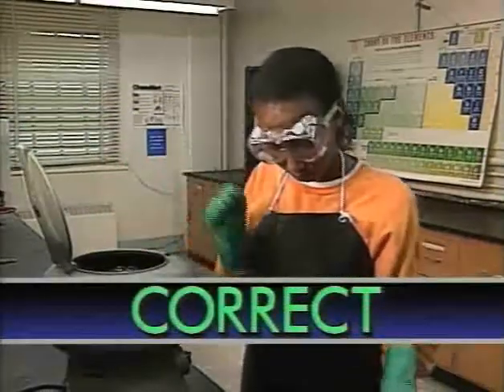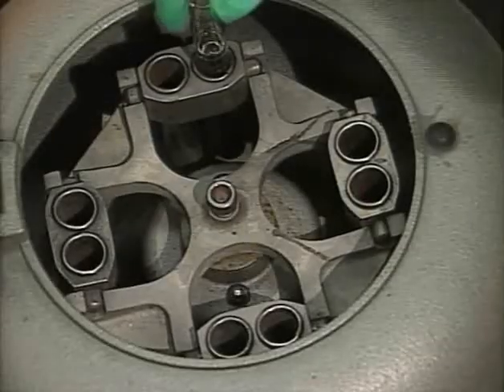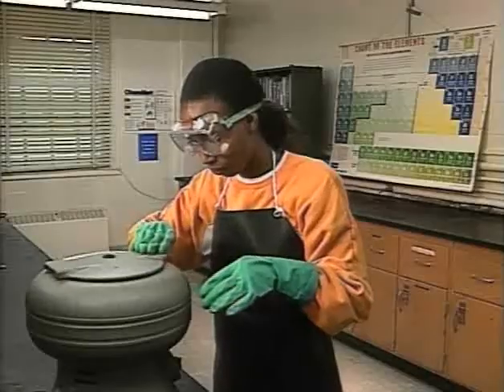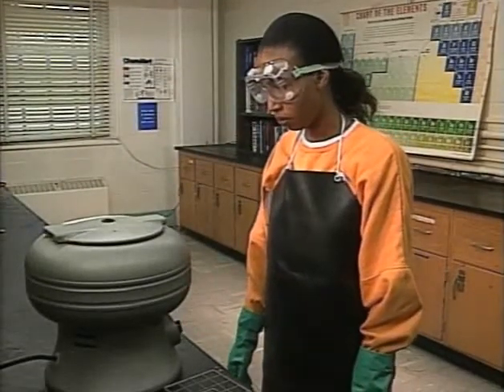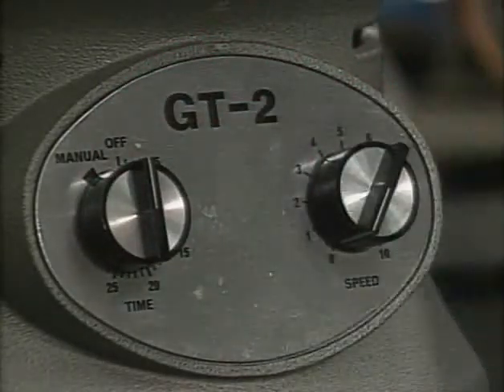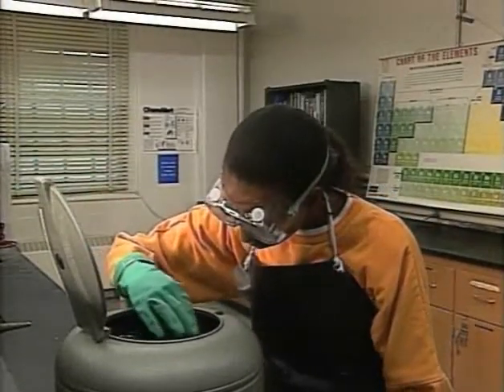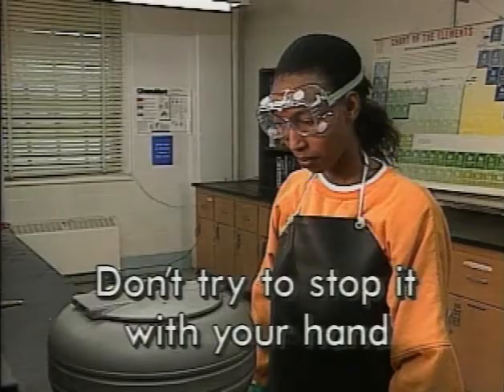To prevent vibration, a centrifuge must be balanced. If you're only centrifuging one test tube, place another one opposite it with an equal amount of water. Once balanced, you can turn it on. When it's finished, turn it off and wait until it stops spinning on its own — never try to stop a centrifuge with your hand.